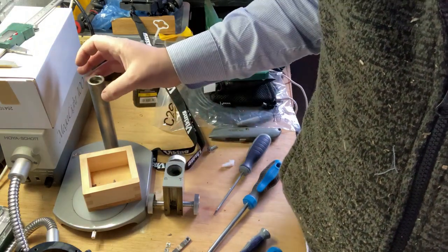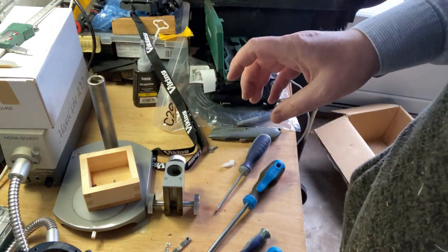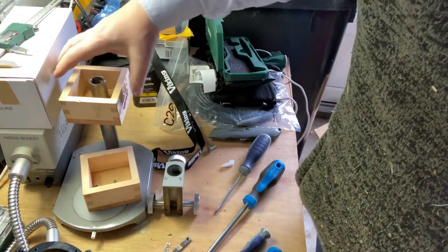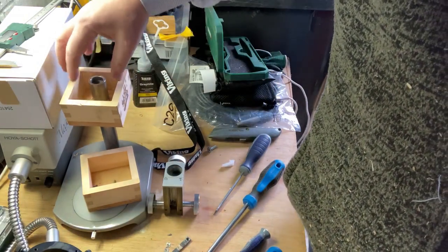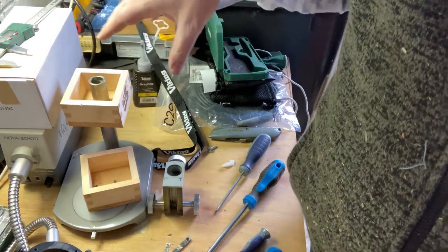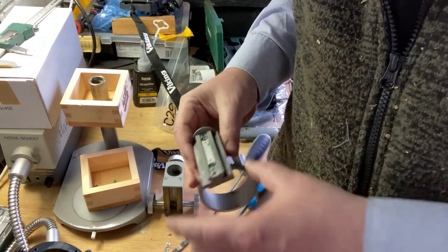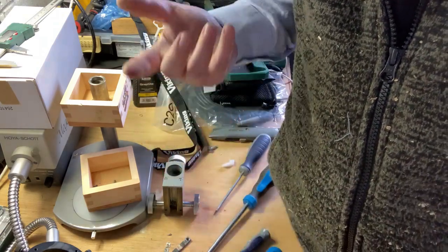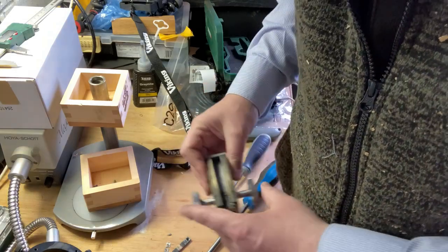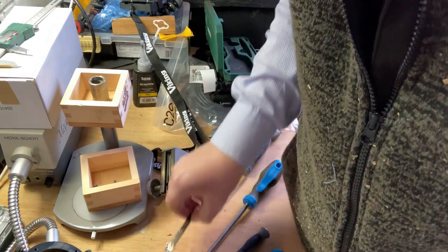So yeah, I've got to create something for here, similar to this. I could have something similar to this, have it attach here, then have the microscope over it. I'll keep the mechanism on it because I can use a little bit of force to keep it moving on it. So let me just quickly assemble it.